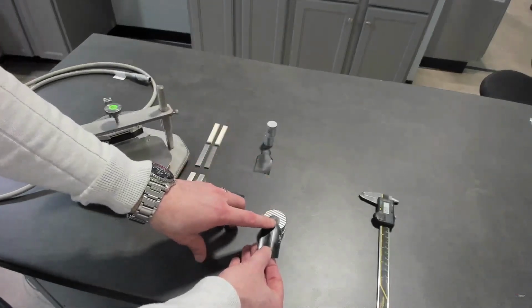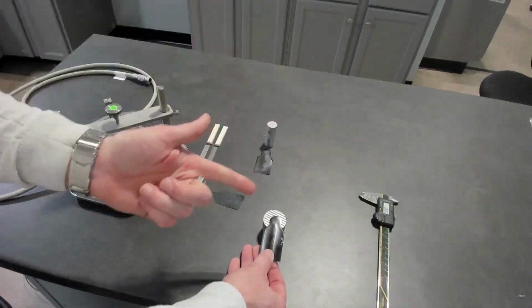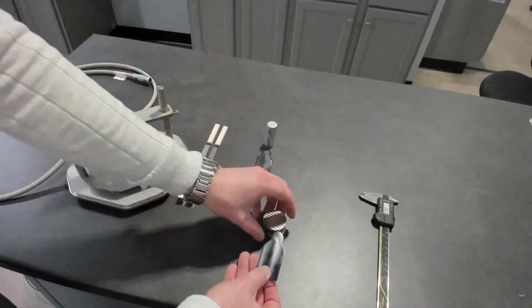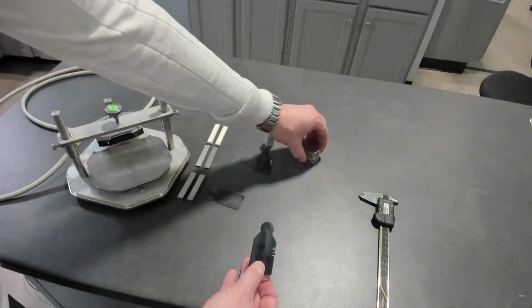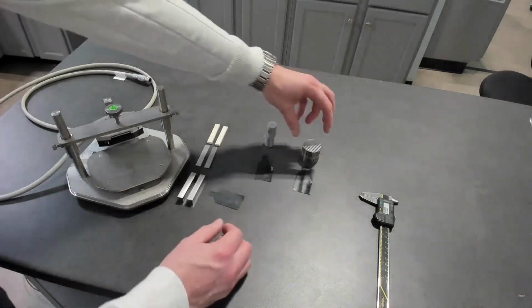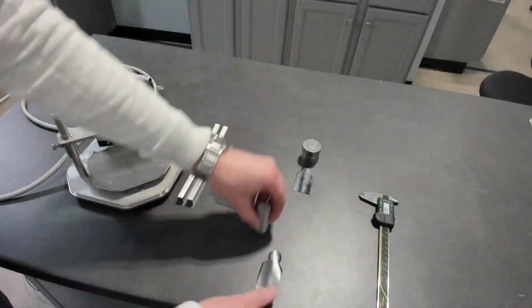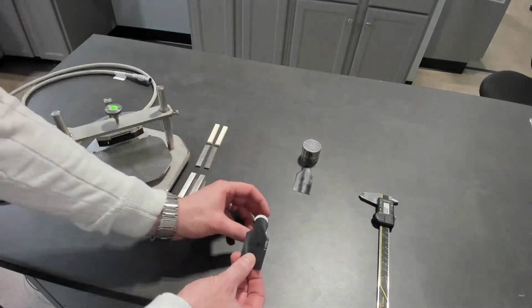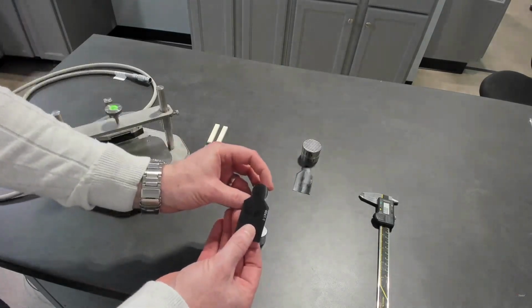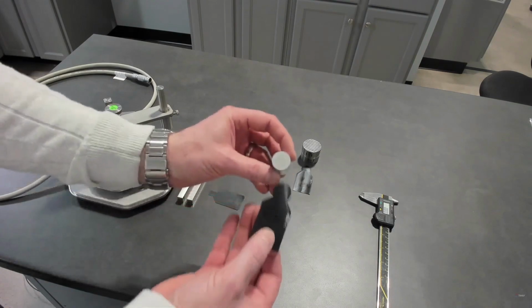There are orientations of that for measuring average values, anisotropic values, slab values, but they're all within that same principal measurement set. If you're limited by radial direction or diameter, you can orientate a TPS sensor so that it matches, or very closely matches, the diameter of the sample you're testing.